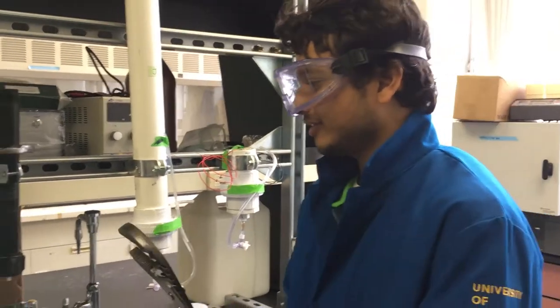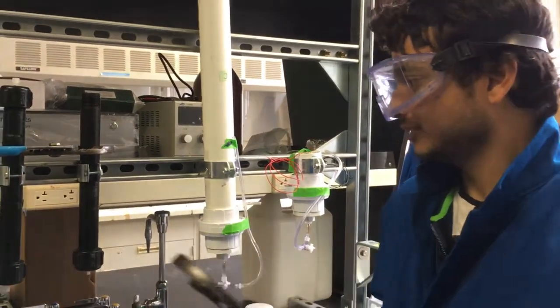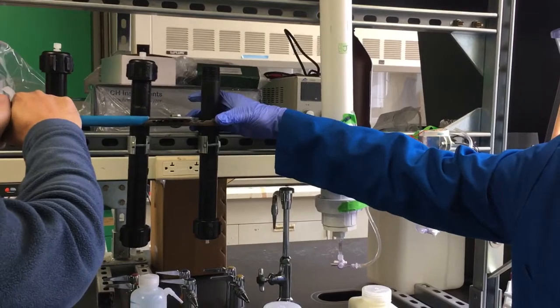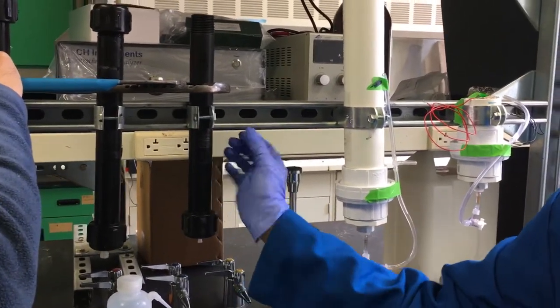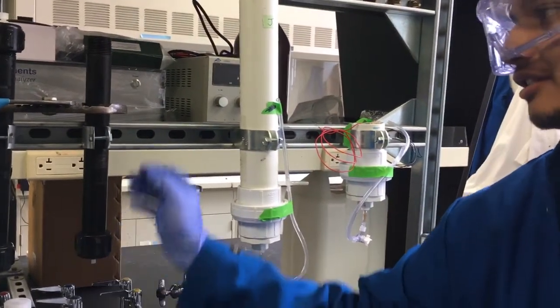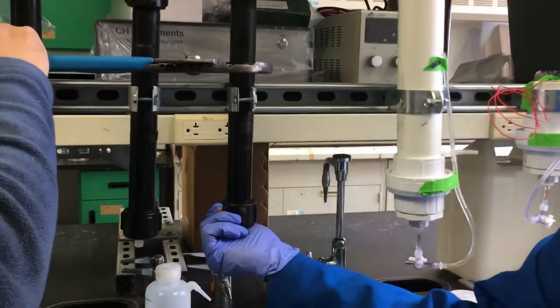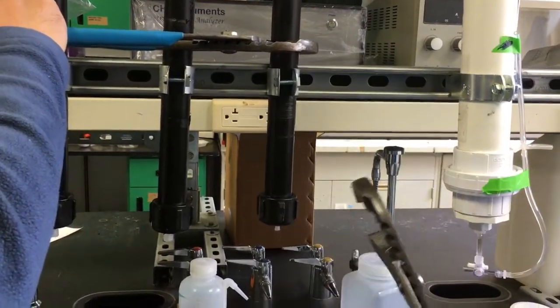So what we are trying to do is screw on the cap of a polypropylene column. To do that, one person has to hold this very tightly with a set of clamps, so that when I turn this, the pipe also will try to rotate with this due to friction. This clamp will try to prevent the pipe from rotating, so that only this thing rotates. So now that it has held it, now I will turn it this way.